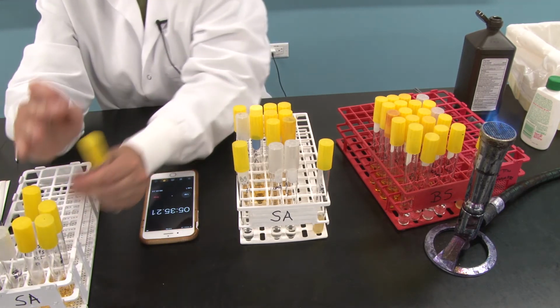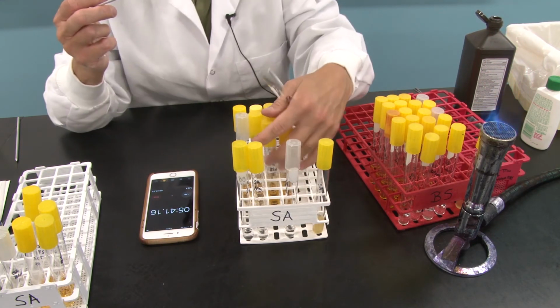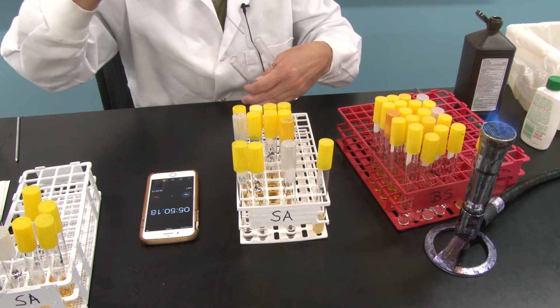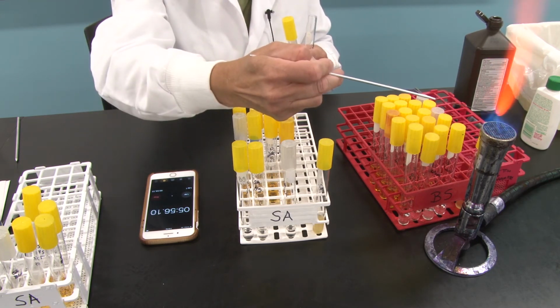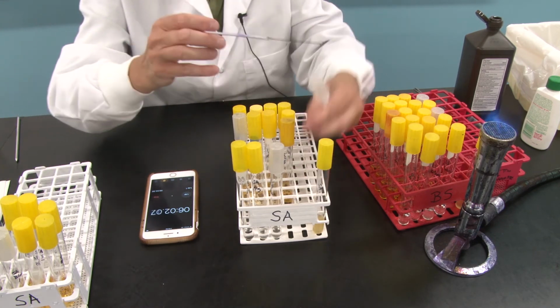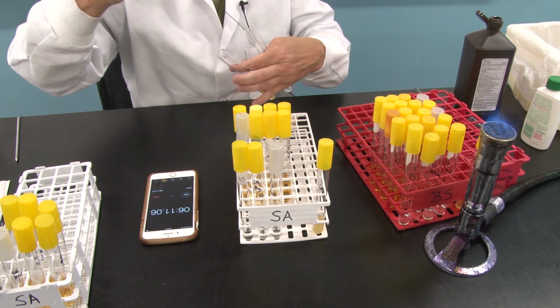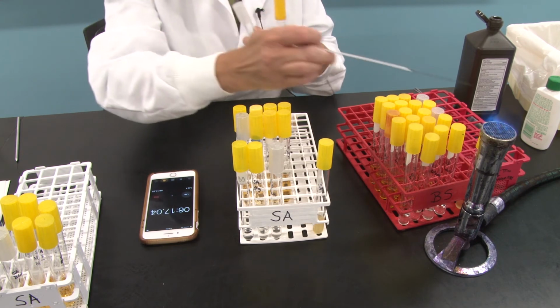put this aside, flame my loop, grab the bleach and the 5 minute tube, and transfer loop. Whoa. There we go. Flame my loop. And grab the Bactine. And I'll see you back at 10 minutes for the next set. Videos are wonderful, so you don't have to wait around. I'll see you in 5 more minutes.